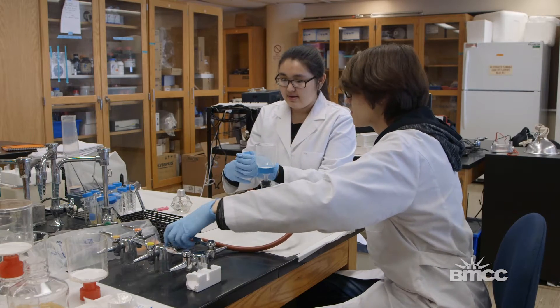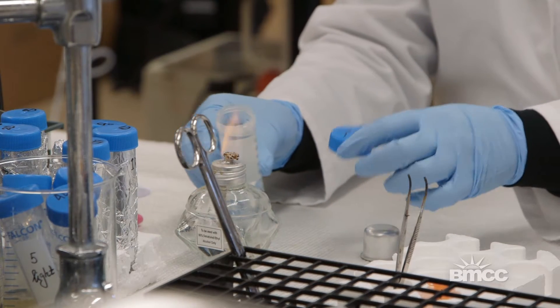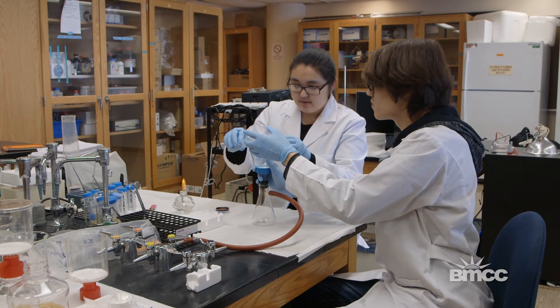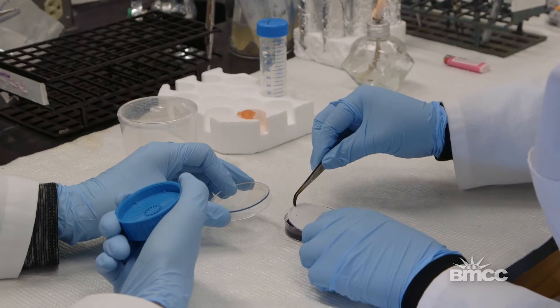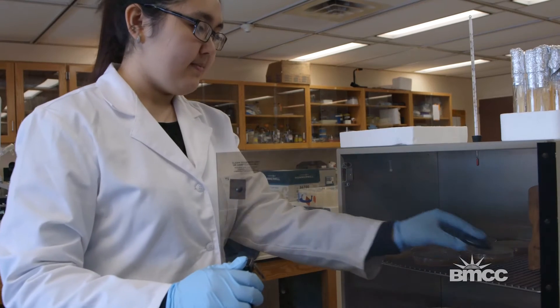Today we're going to start our experiment with filtering our water sample taken from Central Park. We're going to put the filter membrane on the selective agar, and we're going to see the colonies that are growing. If the colonies are yellow, that could possibly be E. coli. If they're purple, they're not.